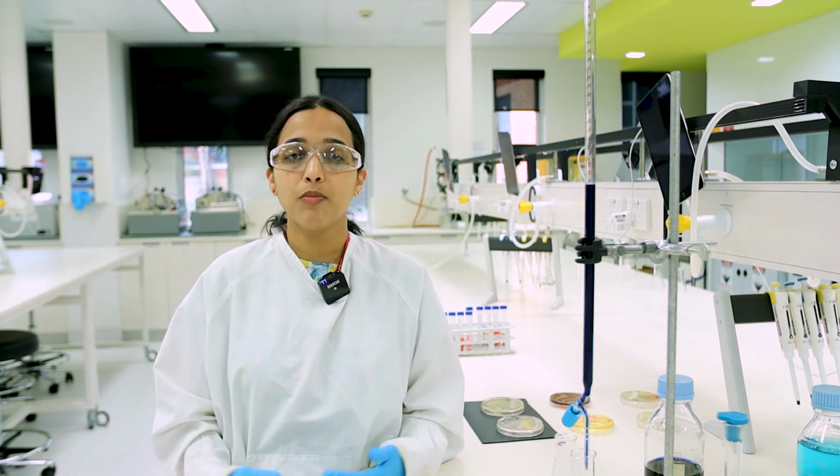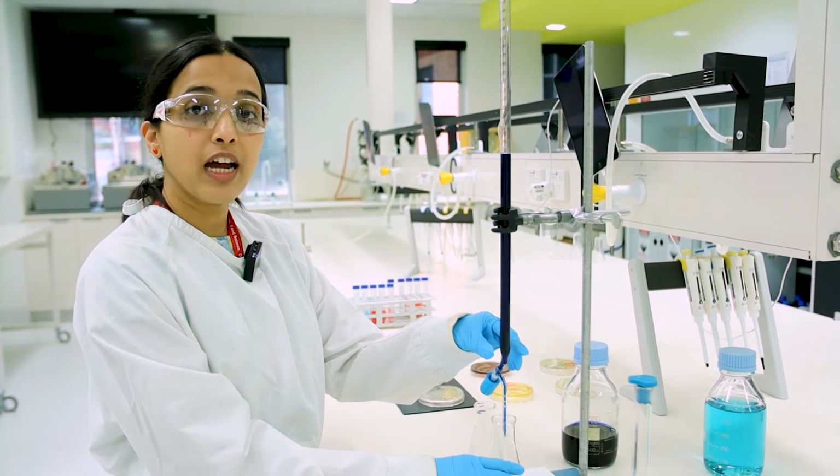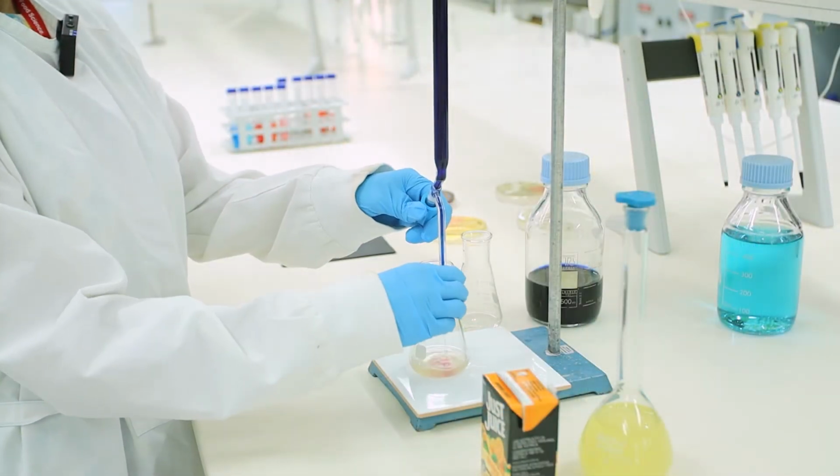What you're looking at is the food science laboratory. Here we have year 1 and year 2 students coming in to do food chemistry and food microbiology. To give you an example, our year 1 students estimate the nutrition information panel for food products by the end of their trimester. So they would be estimating the presence of carbohydrate, protein, fats, and energy content in a food. Another example I could give you is where we do a titration reaction to estimate the presence of vitamin C.